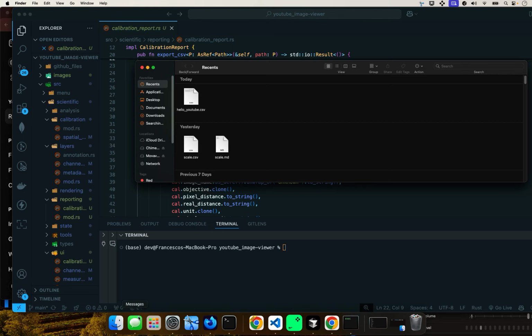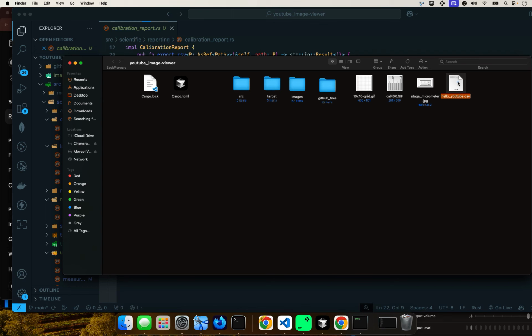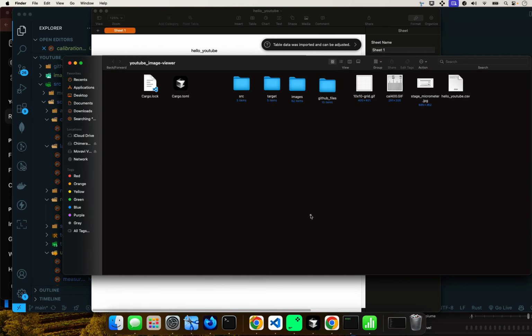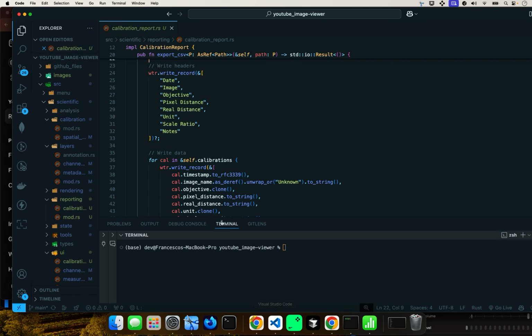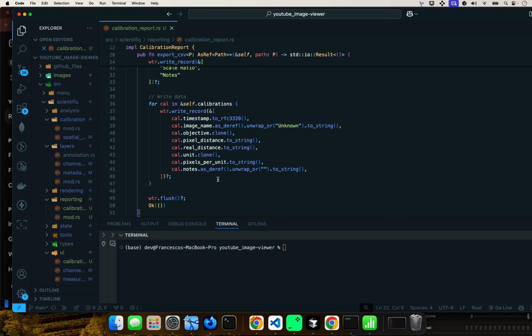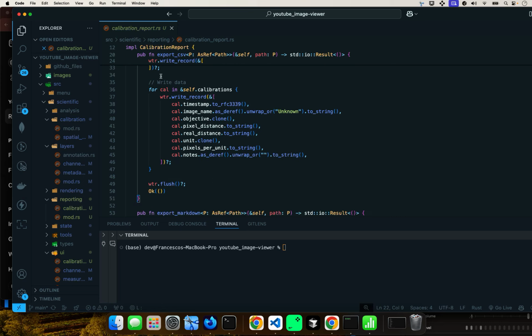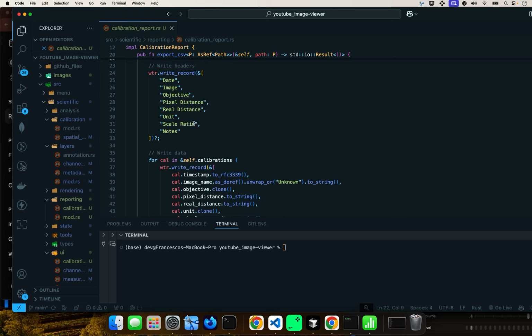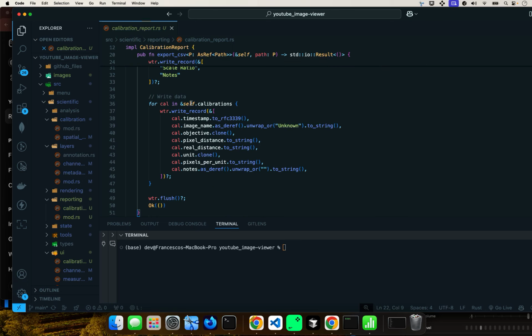Let me just show you up close there. These headers are being created. You see these headers right there? That's where they're coming from. And we continue. This is just writing the data. Here are the headers. This is the iteration with the real information on it.